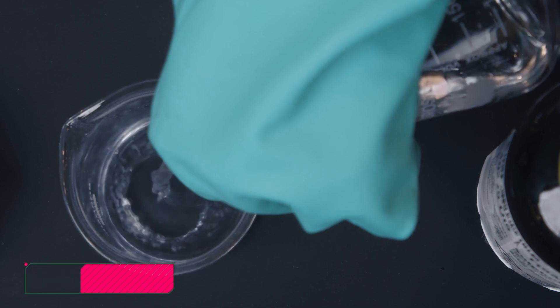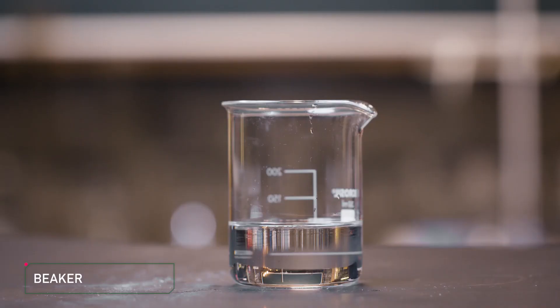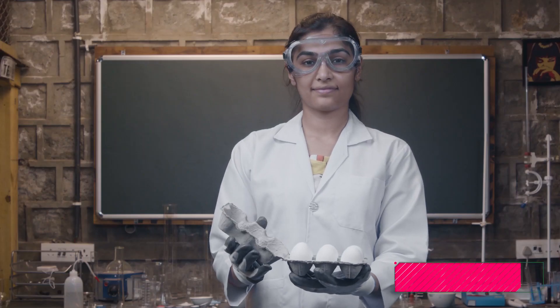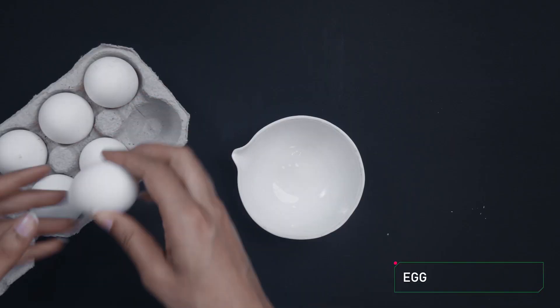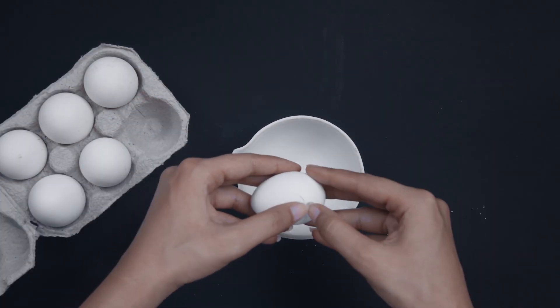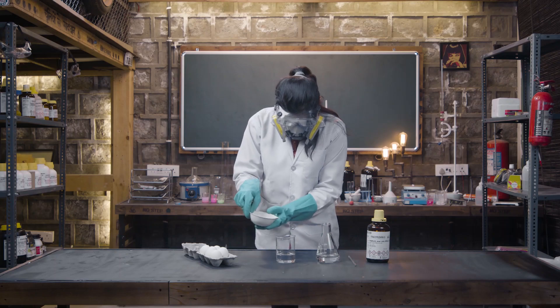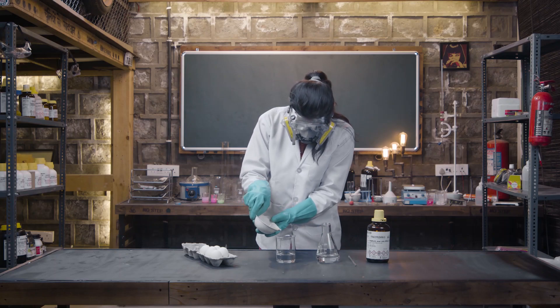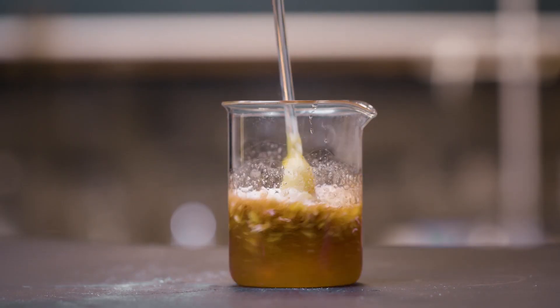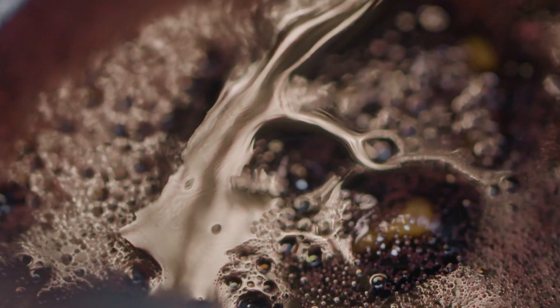Get a beaker and pour in that sulfuric acid till the halfway mark. Now grab an egg from your fridge and crack it open to let the contents fall into the beaker — gently. You don't want to be acid food, do you? Do you see how the egg slowly cooked? And no, don't eat it.